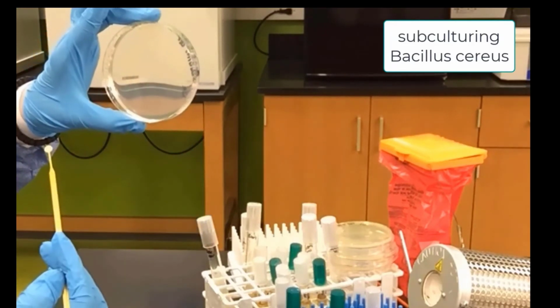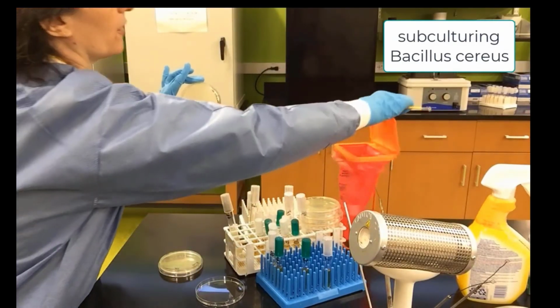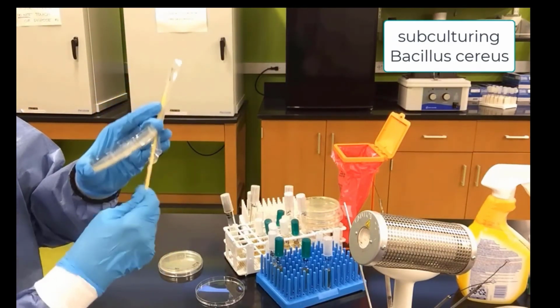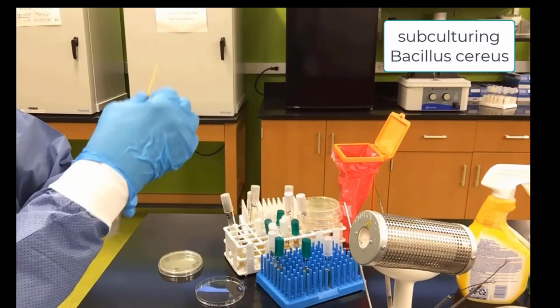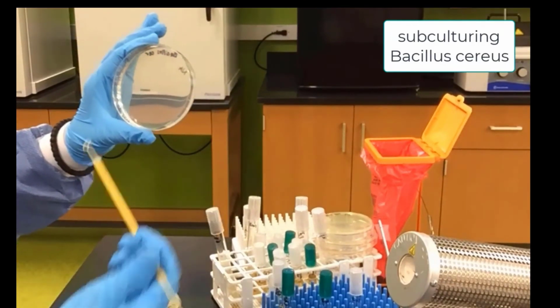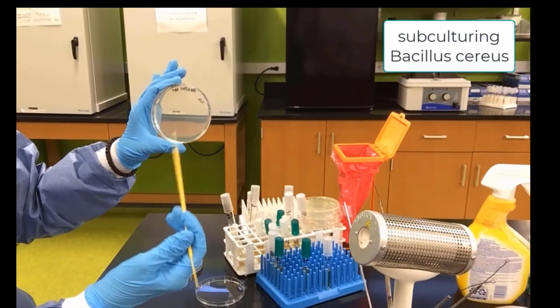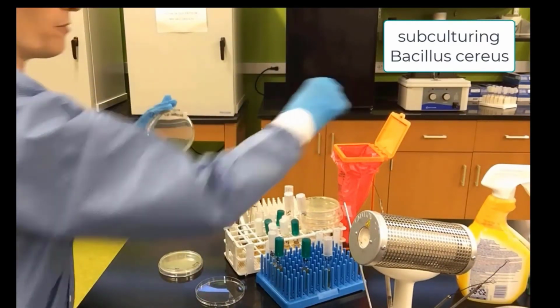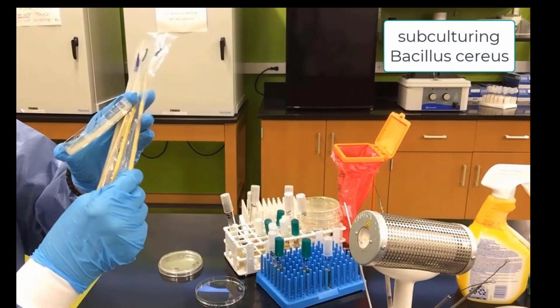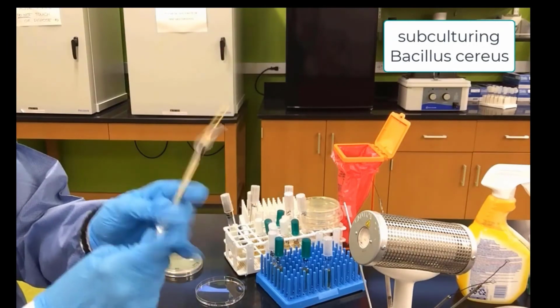Our first streak, we cannot sterilize this, so we do have to throw it away. We have to get a second loop for our second streak. Remember, we will drag bacteria from the first streak into an empty space to form that second streak. Well, we can't use this loop anymore. We have to toss it. And now we will have to get another one out. We have to tear these apart, make it a little easier on us.